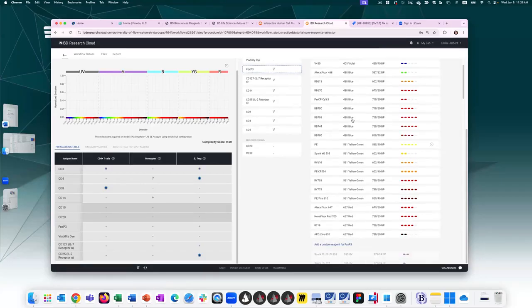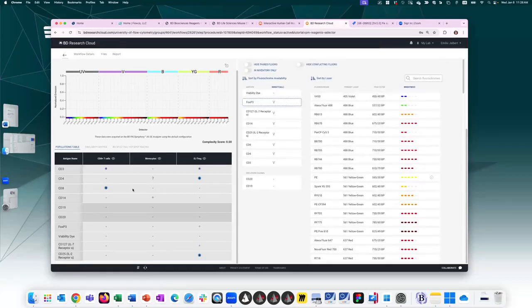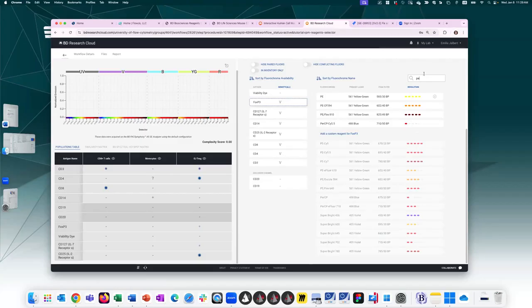So FOXP3 comes in the fewest amount of colors. And if I look over at the table here, it's negative for many of my populations, and my one population of interest here shows me that it has a dim antigen density. So I want to assign it a bright fluorochrome. So here there's the brightness scale, 1 to 5. And I can sort these fluorochromes either by the brightness of the fluorochrome, again, low to high, high to low. I can sort it by resolution. I can sort them by laser line, alphabetically, or I can look up by filtering by the search box.